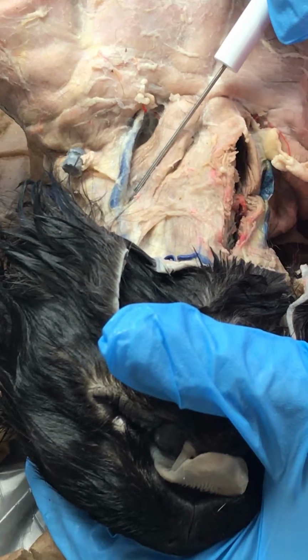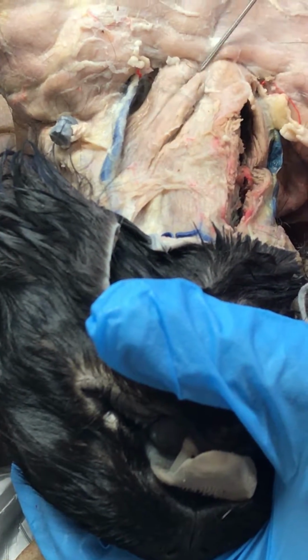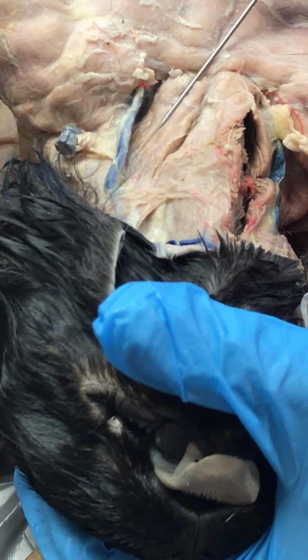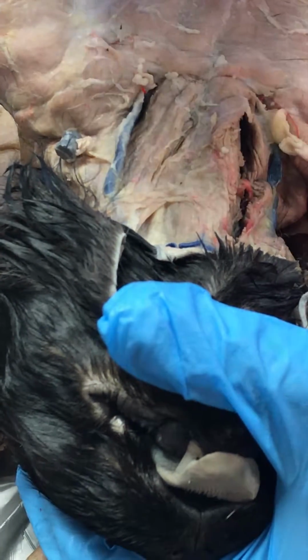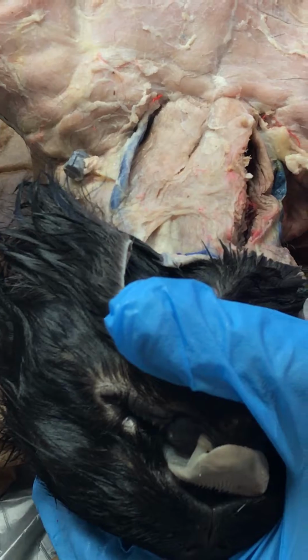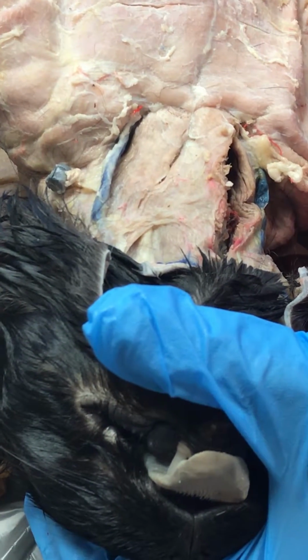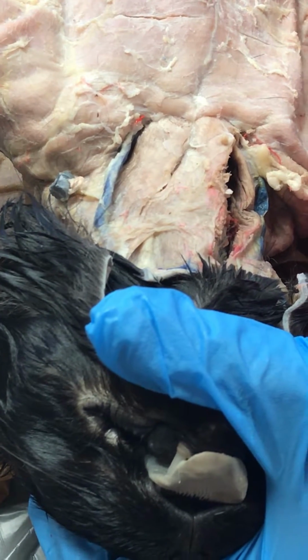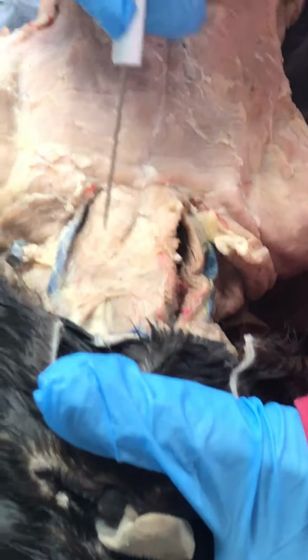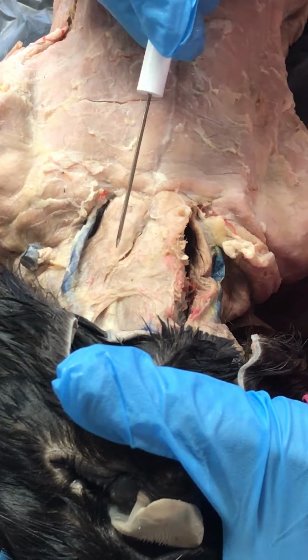Now, the sternomastoid comes in from where the jugular is and down here to the sternum. The fibers run at an angle a little bit into the sternum. So this right here that they have cut is the sternomastoid. Remember, you did not have to find the cleidomastoid because it's too much with this, but I will ask the question, what two muscles unite into one in humans? So the sternomastoid and the cleidomastoid make up the sternocleidomastoid in humans.